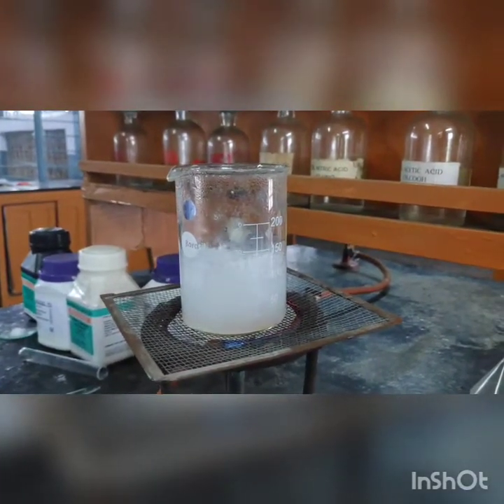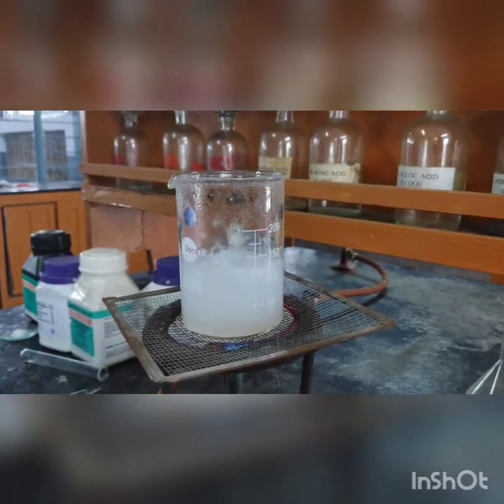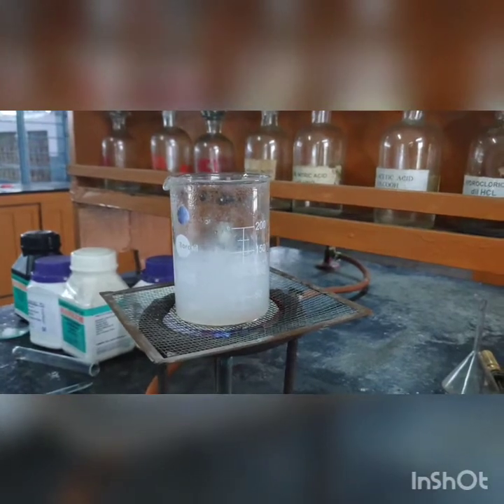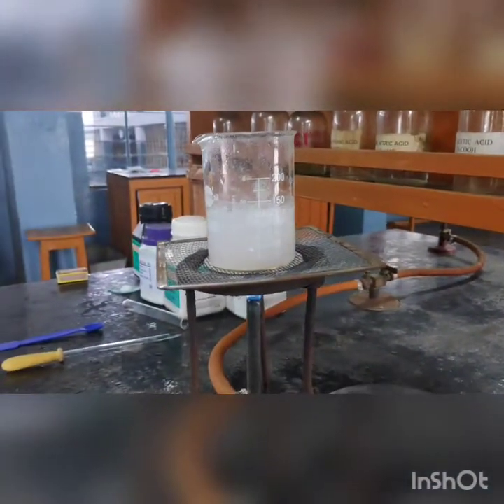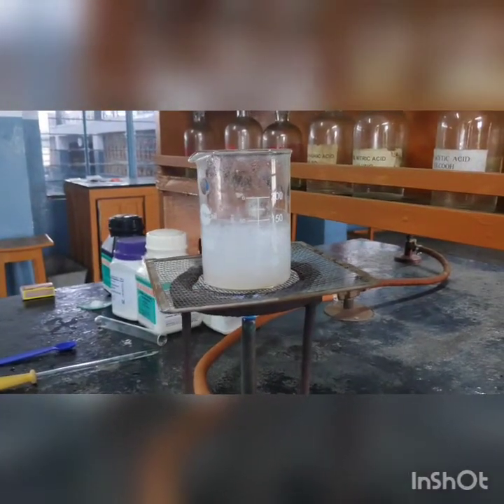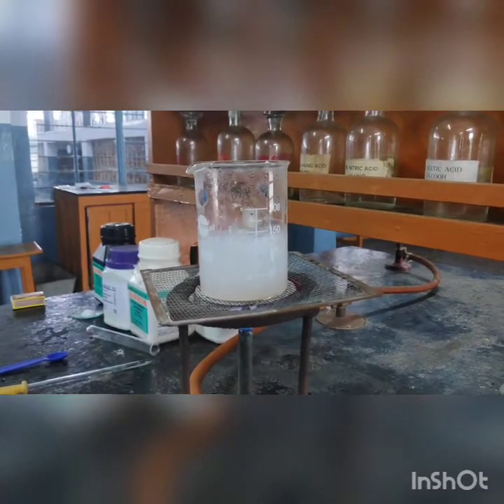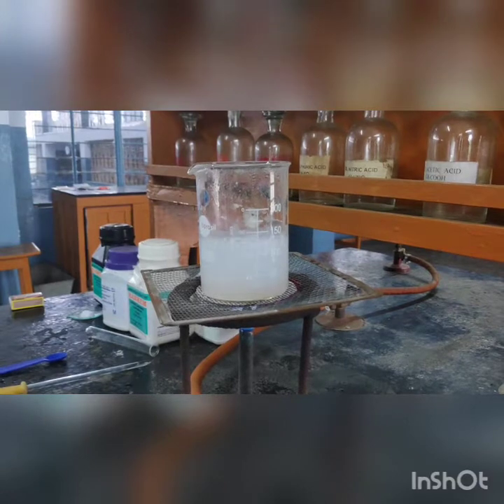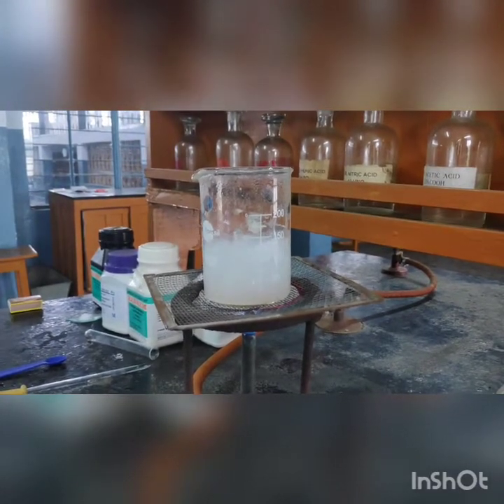After almost 10 minutes of boiling, we will now filter the solution to obtain the filtrate and the precipitate. The filtrate will be used for testing the anions after acidifying it, and the precipitate will be used for testing the cations after preparing a suitable original solution.